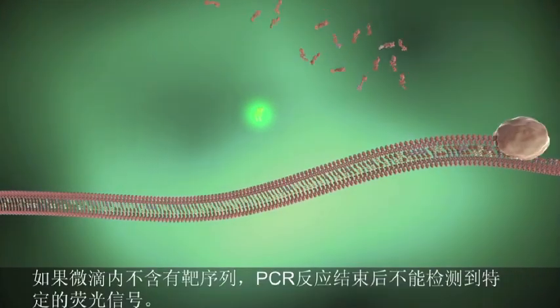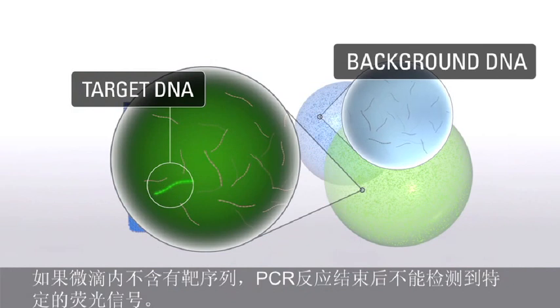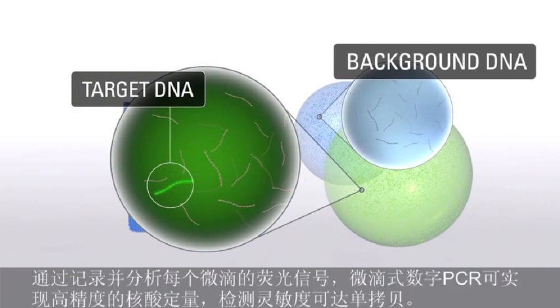signal. If the target sequence is not present in a droplet, no PCR will take place and only weak residual fluorescence is emitted. By scoring each individual droplet for a fluorescent signal, droplet digital PCR achieves absolute quantification with a high level of precision and single-molecule sensitivity.